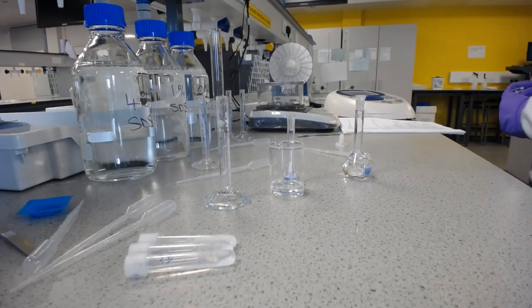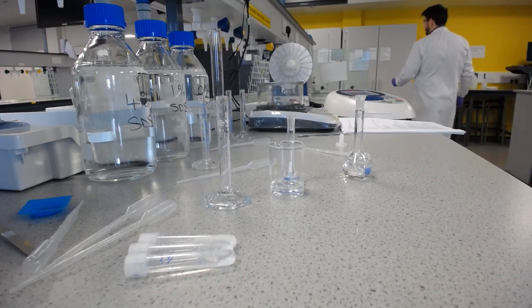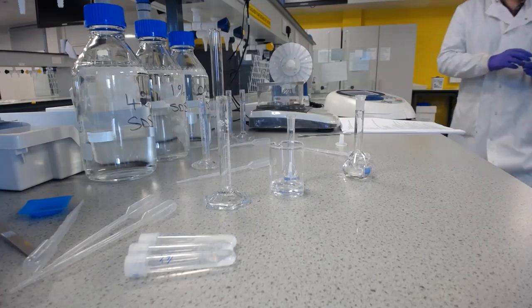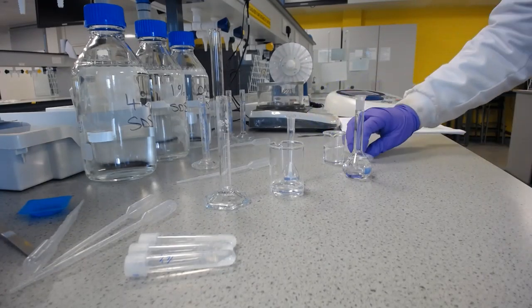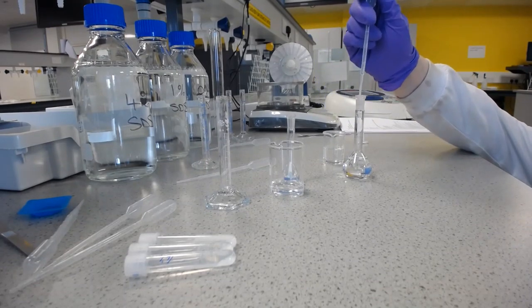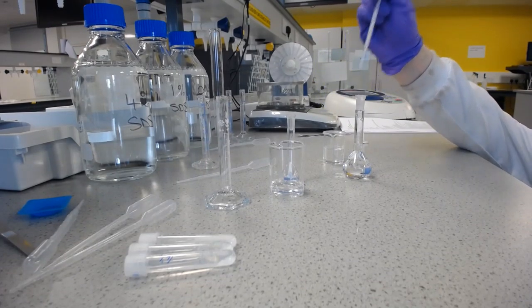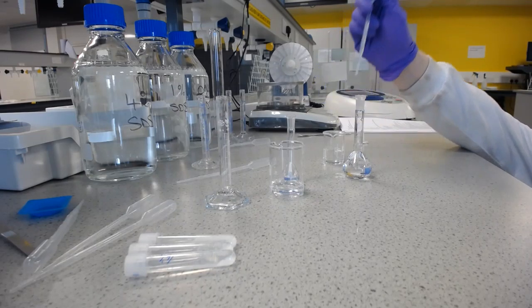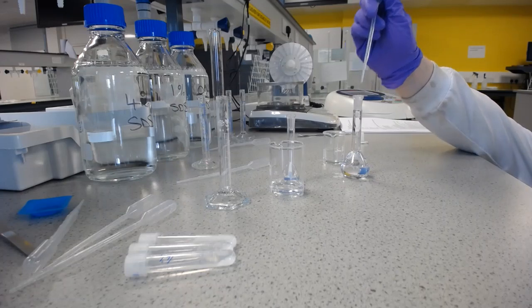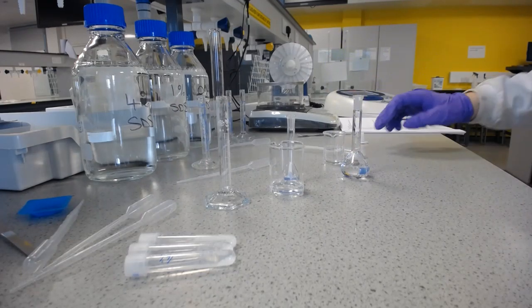And I'm going to need just a little bit more. There we go. Perfect.